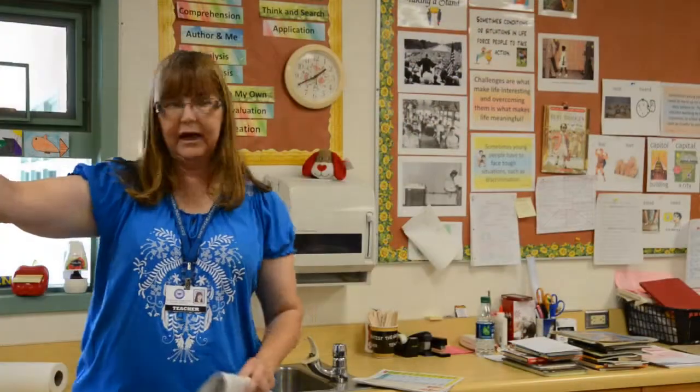This is a simple experiment, which is a chemical reaction between steel wool. If you see the package, it will look like this, and then vinegar.